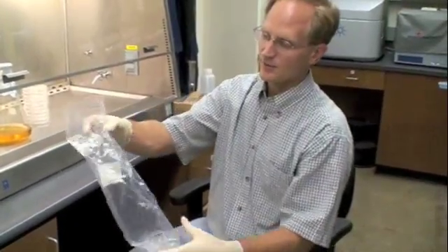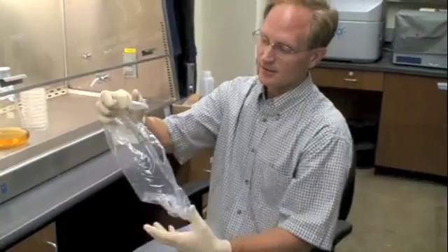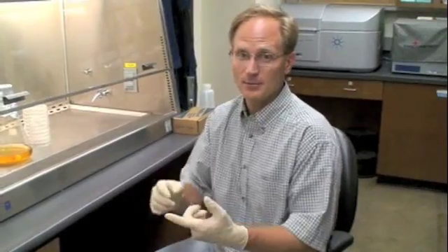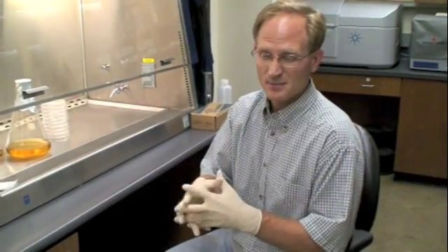Sometimes if it's cut nicely, then you can reuse the sleeve as a container and tape the top. Now every one of these plates that I'm pouring, I need to put my name on them, the class or project that I'm doing, and also the date. Those three things are important to have on every plate. Every so often, we go through the fridge, and we'll throw away plates that are not labeled, and plates that are expired more than six weeks or so. Because the bacteria on them really aren't that good anyway, and usually people have got what they need after that amount of time.